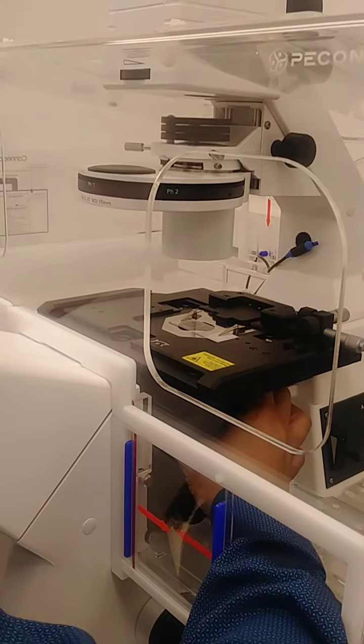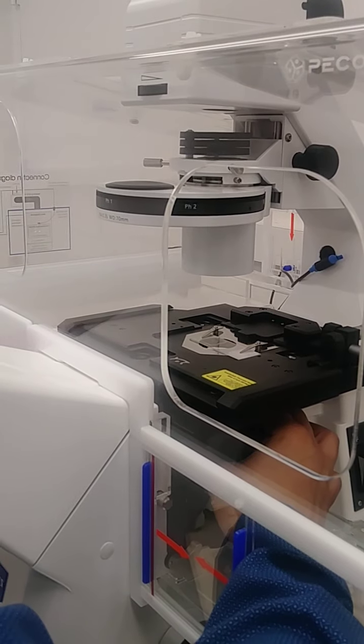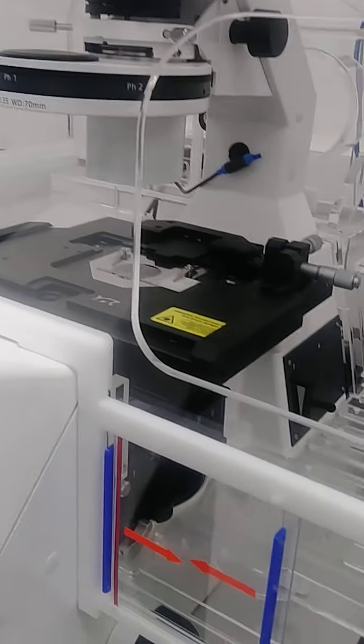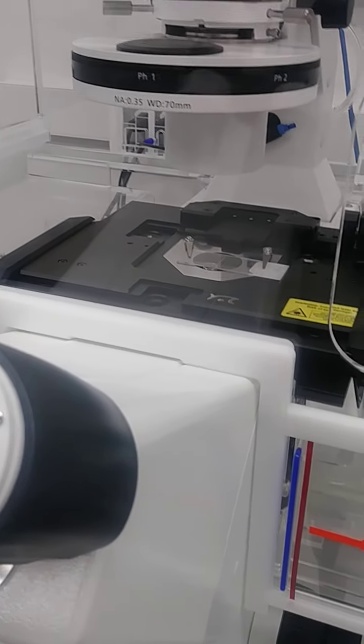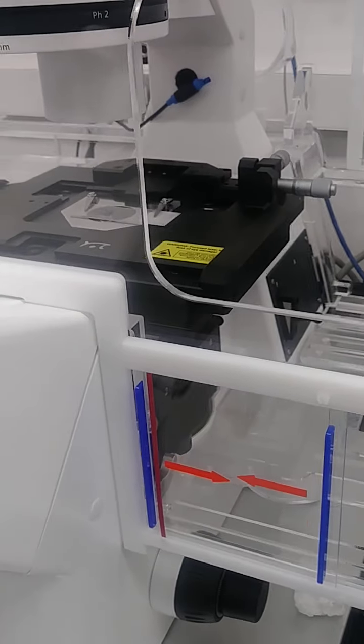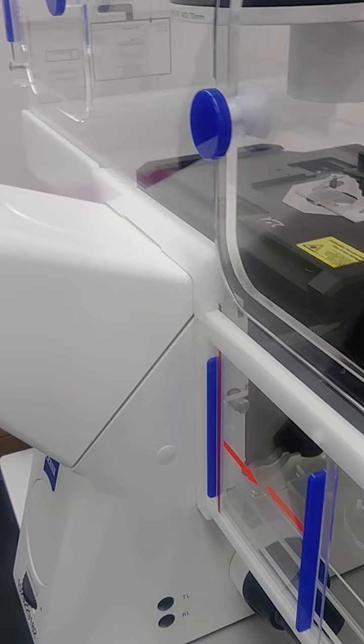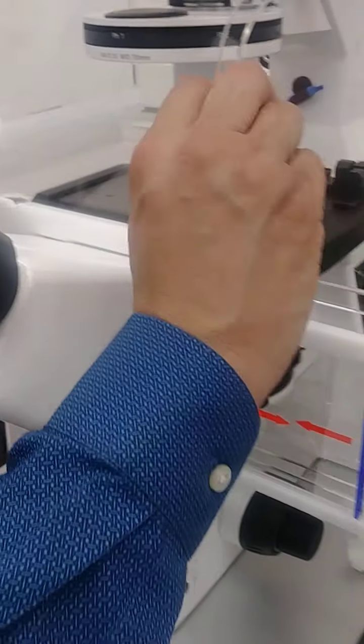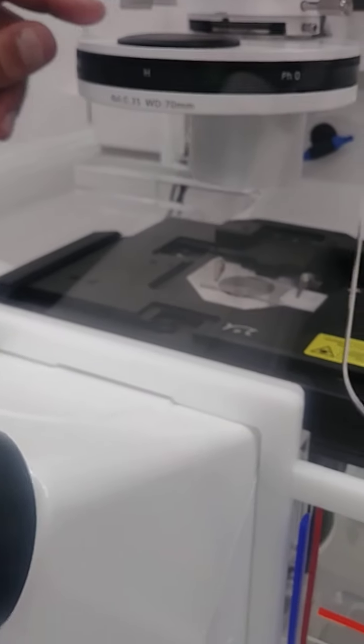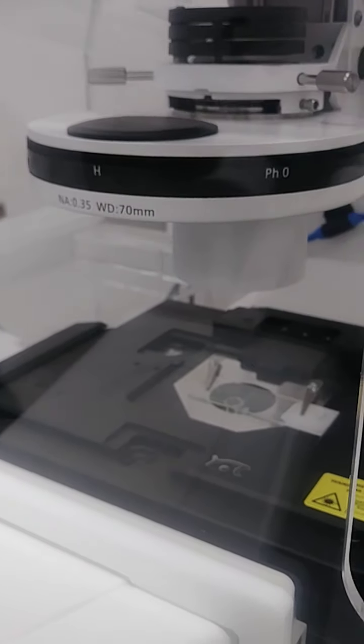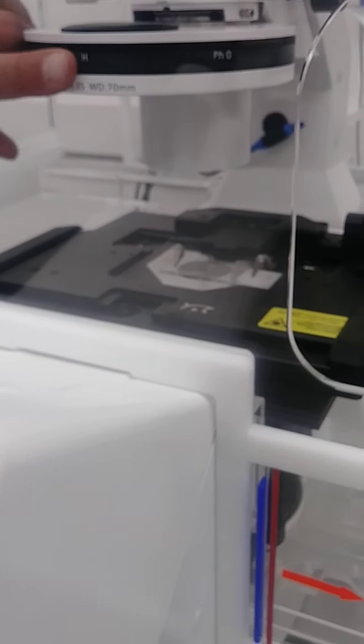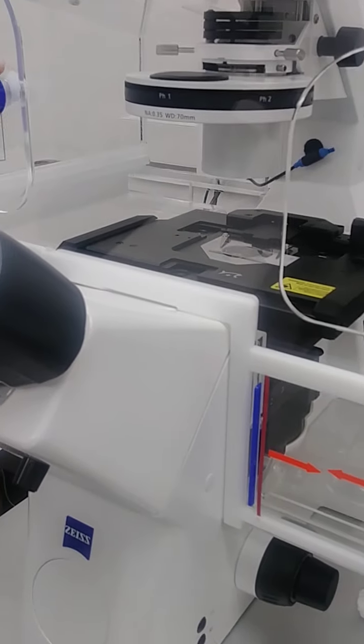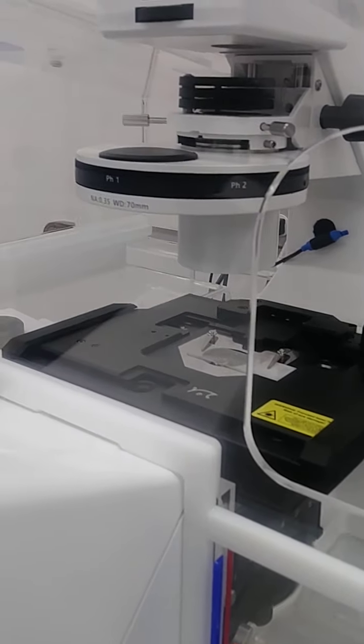So I guess the 10 actually could probably put an H into H, which is Brightfield. It's German for Brightfield. They want to confuse everybody. So like, so then now if we want to switch back to Brightfield. So you want to look at Brightfield or... Yeah. We're in Brightfield. Right. Oh, but instead of phase contrast, what is like another... Oh, so Brightfield, so if you're a 10, there's no phase number on the objective. The H. Is, there is nothing in there. So the phase ring, if you have a phase ring in there, there's something in the back of the objective that's blocking some light. So the best throughput for the 10 is H. And then the 20 and the 40 is phase one. So I will always use this setting. Because it's objective specific. And I will do what you showed me to align that.